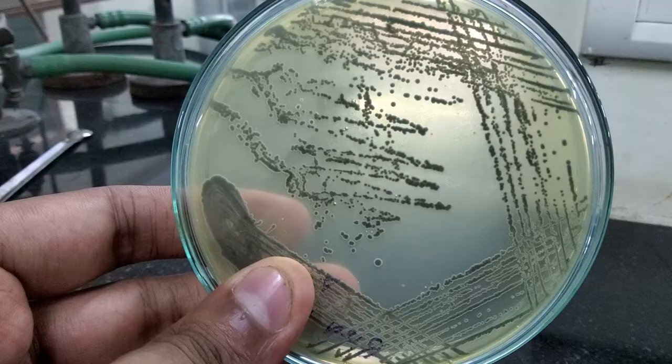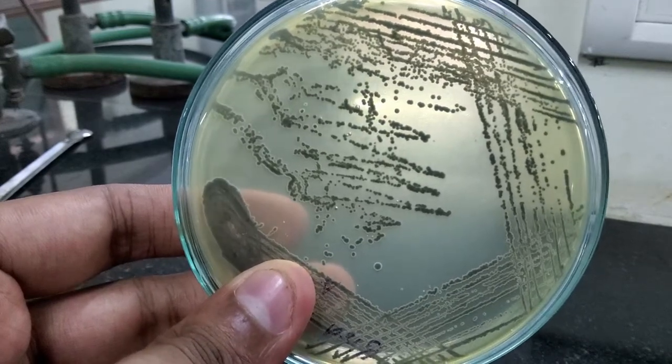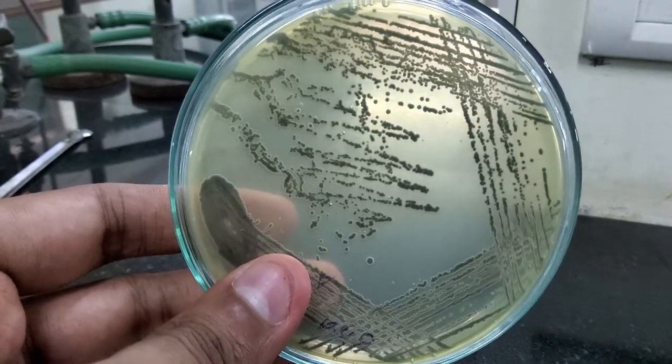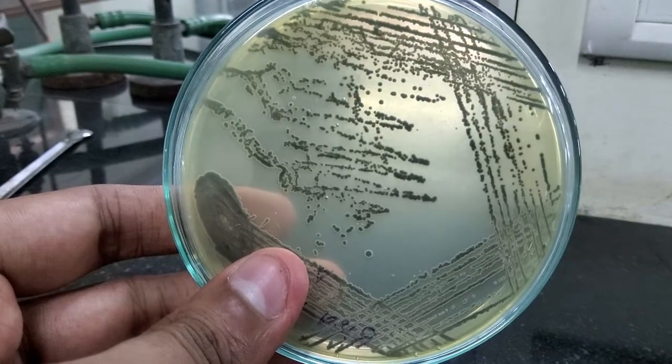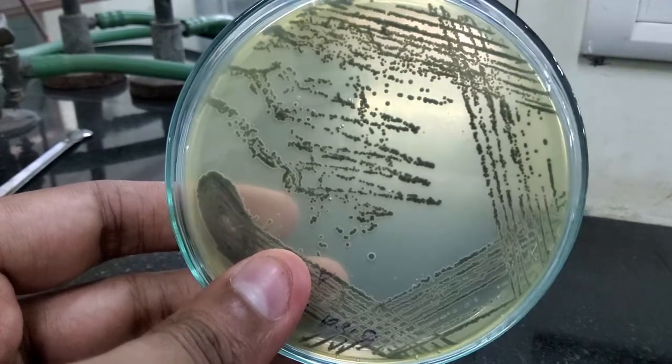After 48 hours of incubation, I am here to show you the results for detection of lecithinase on Baird-Parker's agar. I have streaked S. aureus on Baird-Parker's medium because S. aureus is known to produce lecithinase. You can see here that it has produced black colored colonies on Baird-Parker's agar. Normally it shows growth in 24 hours, but to observe clearance around the colonies we incubate the plates further.